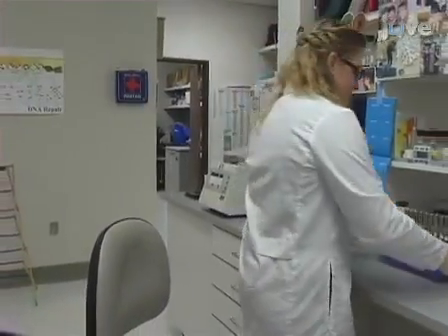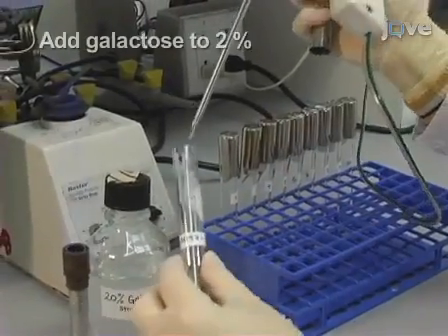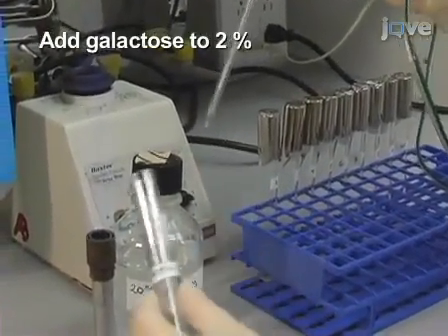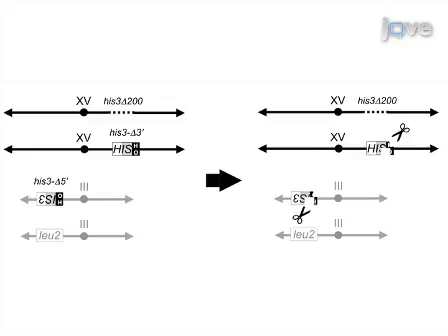When the cultures have reached the desired cell density, add 20% galactose to the cultures to a final concentration of 2%. The galactose will induce expression of the HO-Endonuclease, which will direct double-strand breaks at the his3 delta 5' allele on chromosome 3 and his3 delta 3' allele on chromosome 15. Incubate for 4 hours.